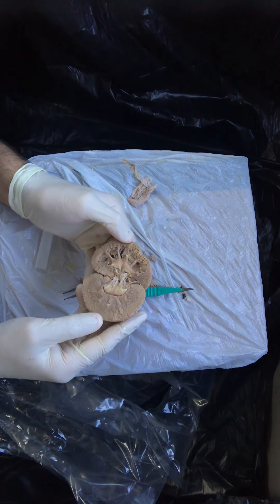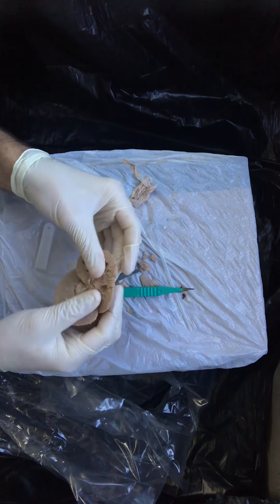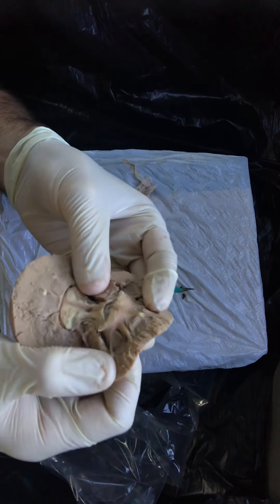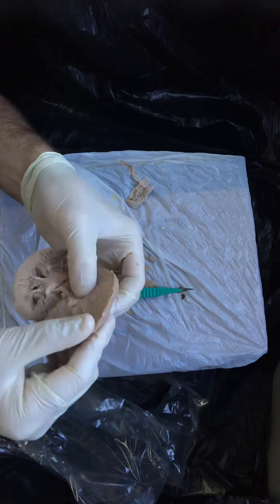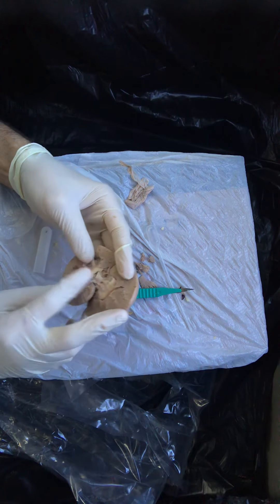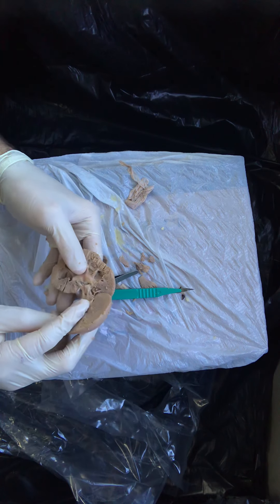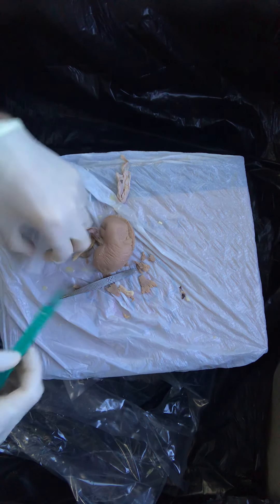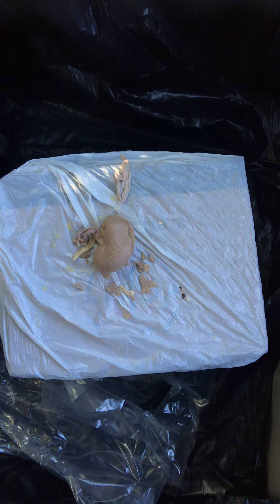The separation between the pyramids and the collecting system is just an existing normal anatomic plane. With just a little bit of pressure like this, you can separate those things and start to dissect further and inspect that. And if you're lucky, you can even see where the renal pelvis becomes the ureter, but that view is difficult to see the way these specimens are produced. Alright, so we'll start and stop this video together and we'll take a few minutes and look at your guys' specimens and see some of those structures too.